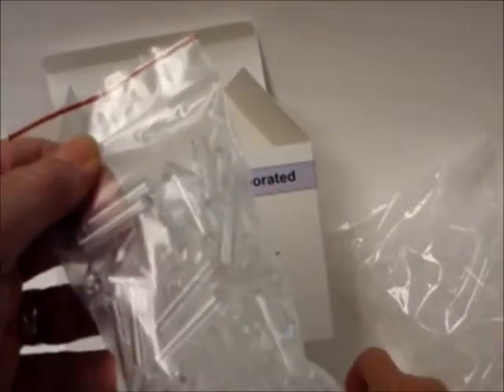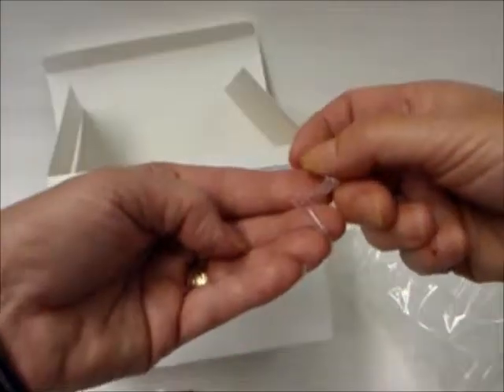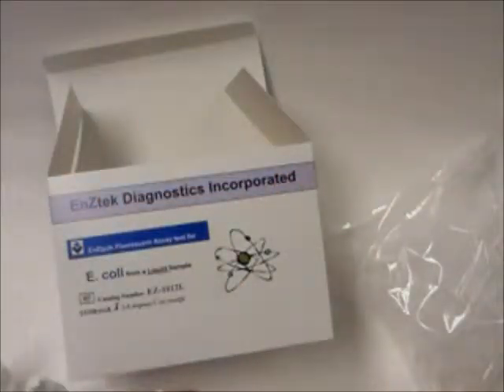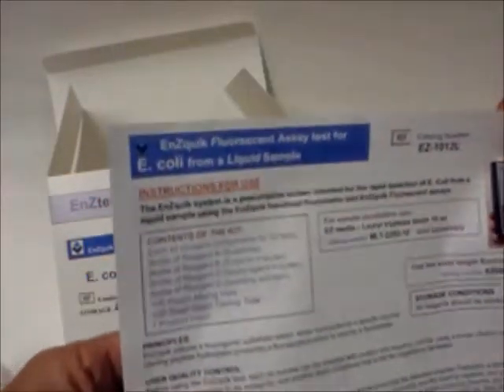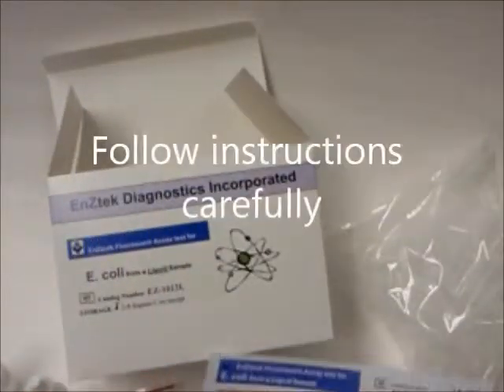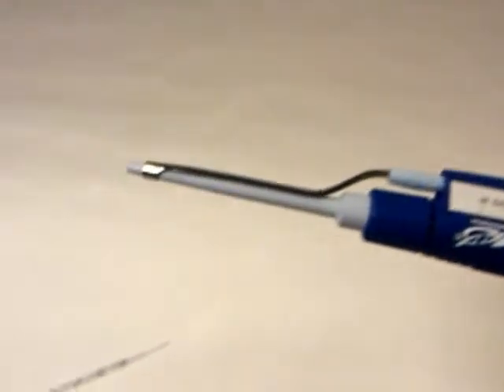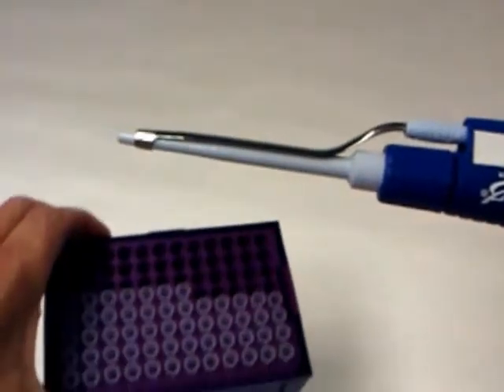Some kits do not require the small glass testing tubes and use small plastic test vials instead. The correct contents are listed on each product insert. It is important to follow the instructions carefully, as any deviation could cause an invalid result. You will need to have a pipette or a calibrated pipetter with disposable pipette tips. As an alternative, disposable transfer pipettes can be used. Always use proper techniques to avoid cross-contamination.